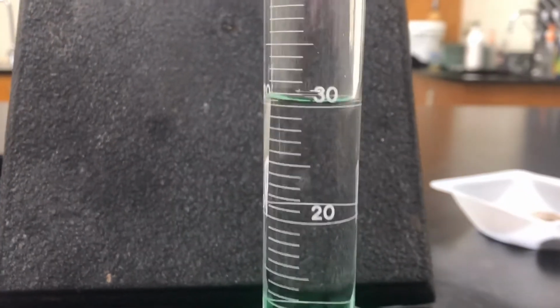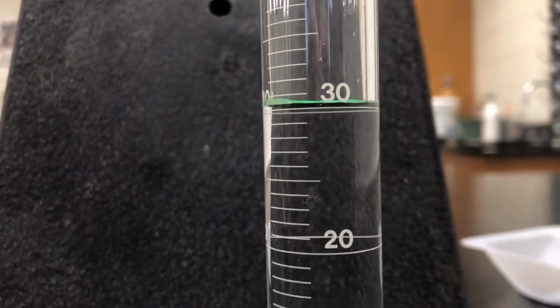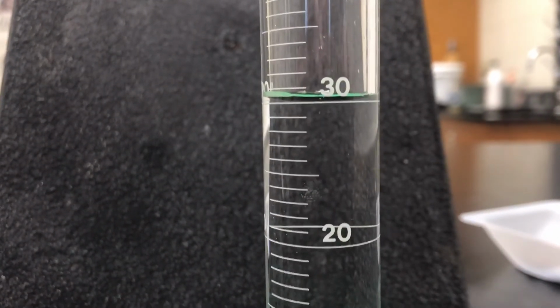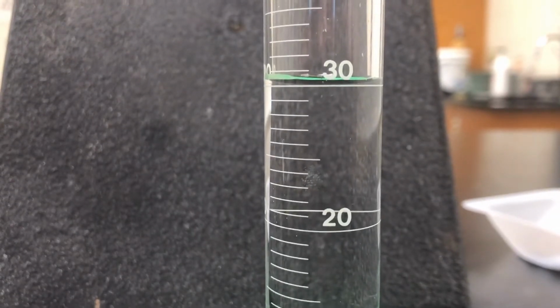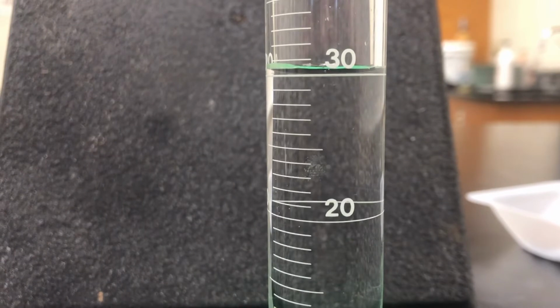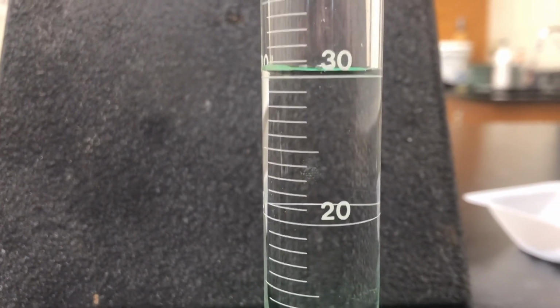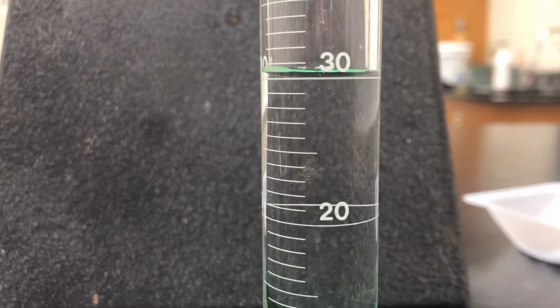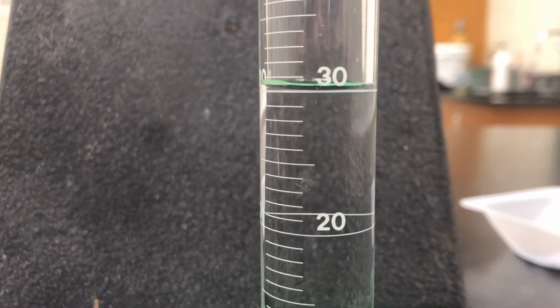be kind of parallel, okay? You need to be able to see right there. See how that, then bring it together. So this one's pretty nice. I've pretty much got the meniscus right at 30.0 milliliters. So remember, we know it's more than 30, less than 31, so one more out would be 30.0 milliliters.